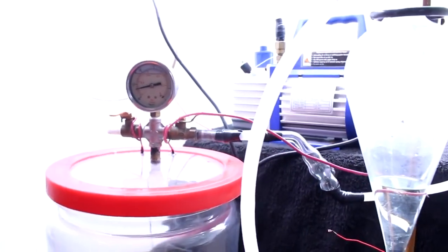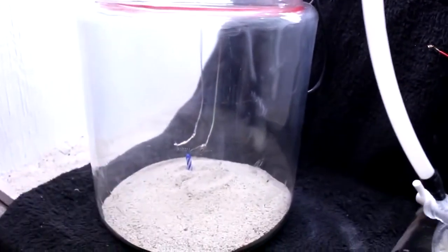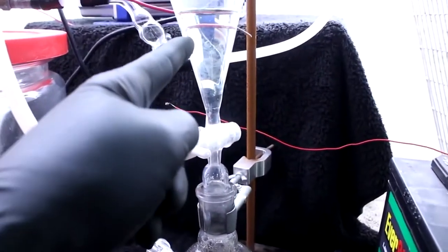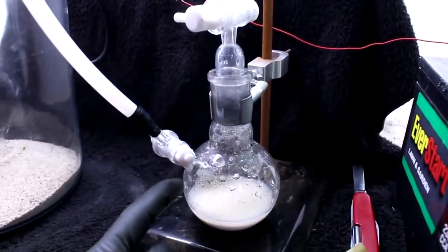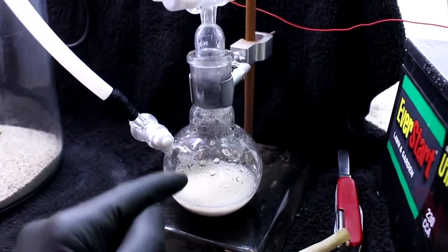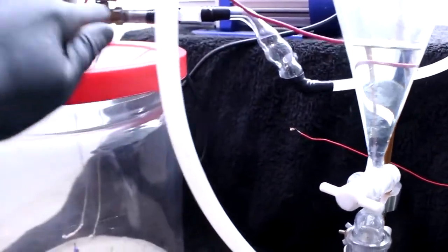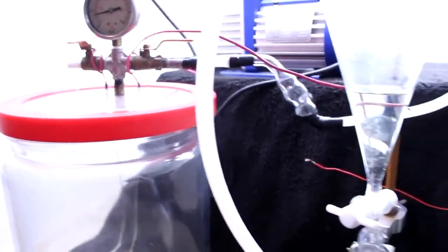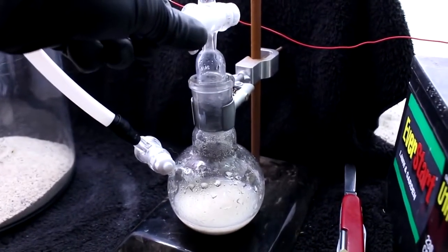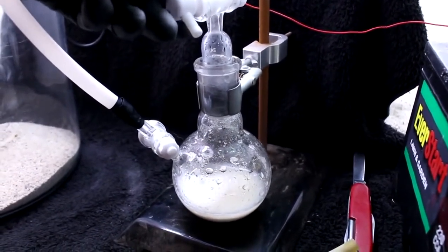Here's what I've come up with. I have a jar that I've evacuated of all air, with a little candle inside, an electrical igniter, and a chlorine generator. I'm going to drip some hydrochloric acid into a chamber filled with calcium hypochlorite, which will produce calcium chloride, water, and chlorine gas. The chlorine gas will go up this tube through a bubbler and into the chamber. I'm going to start adding the hydrochloric acid to produce the chlorine, just very slowly, drop-wise.